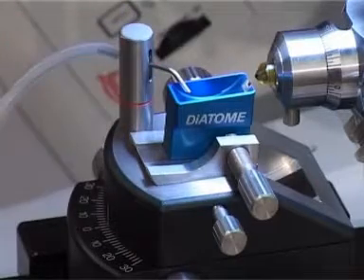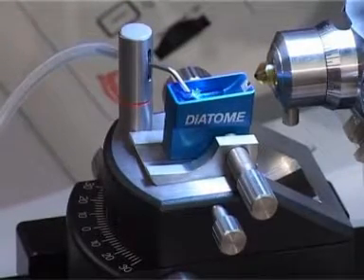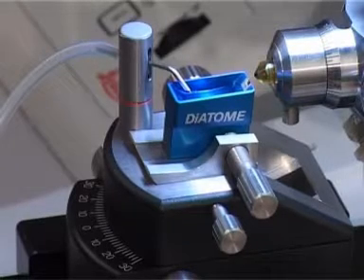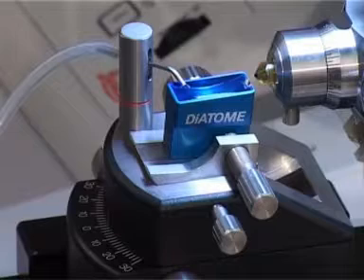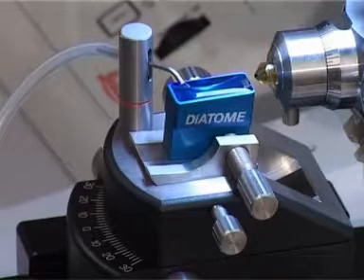With the illumination returned to the top light, the spout of the reflexor mat is attached to the knife carrier and the boat is filled with water. The water level can be precisely adjusted using the reflexor mat.